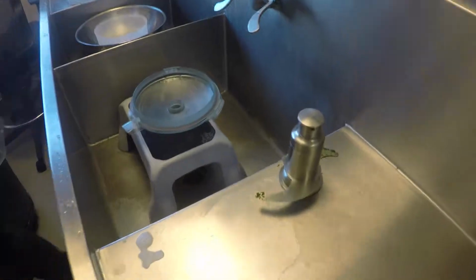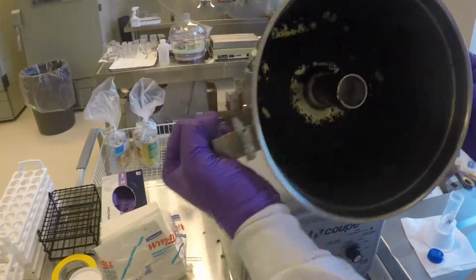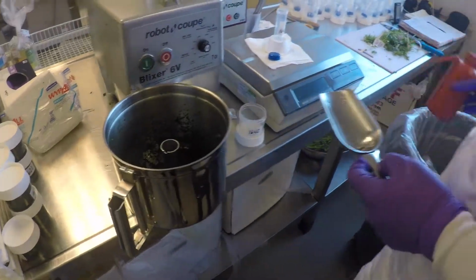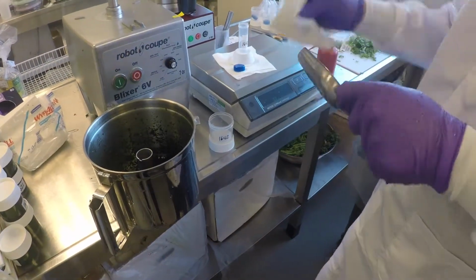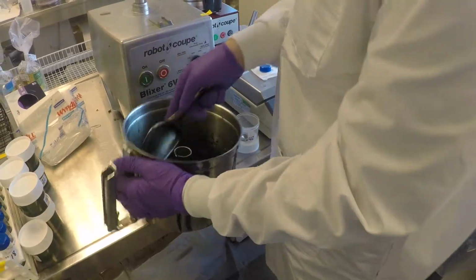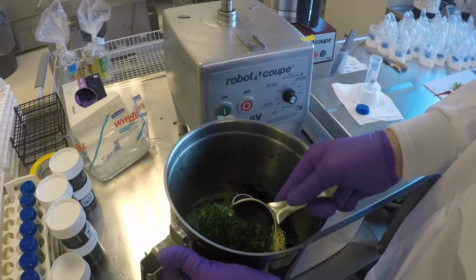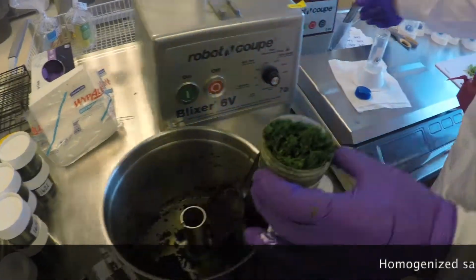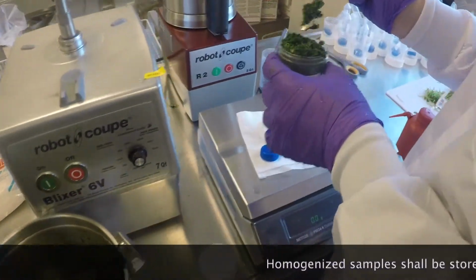Two subsamples of each composite shall be weighed into appropriate containers. Prior to weighing samples, a 10-gram weight shall be placed on the balance. The weight displayed by the balance and the date and initials of the analyst shall be recorded in the sample logbook. This shall be done once each day the samples are weighed.